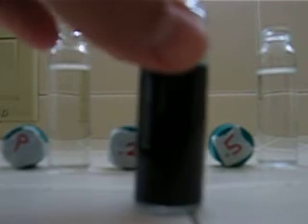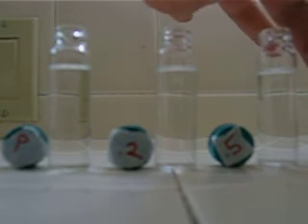Ok so here we have our three samples and we take our indicator solution. The first sample is pure methanol and I put a drop of the indicator solution in there. It sinks right to the bottom.